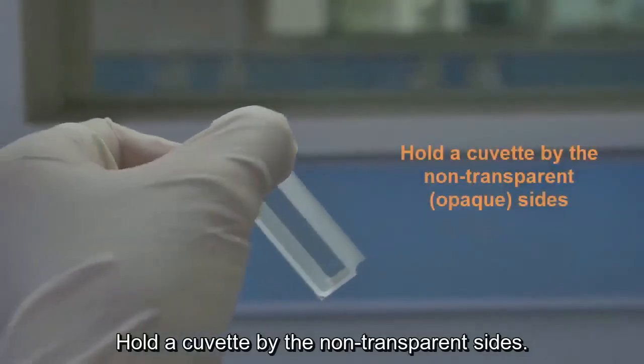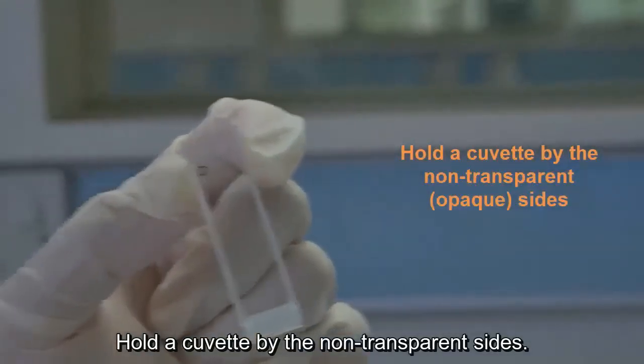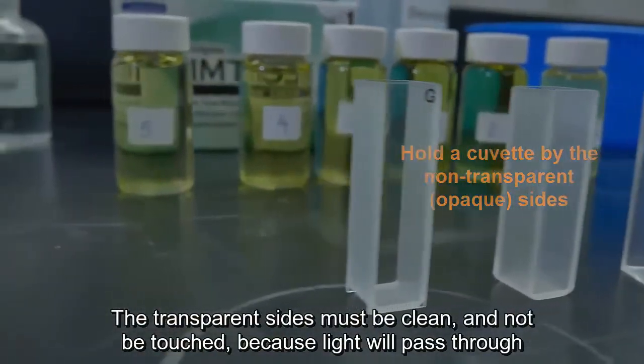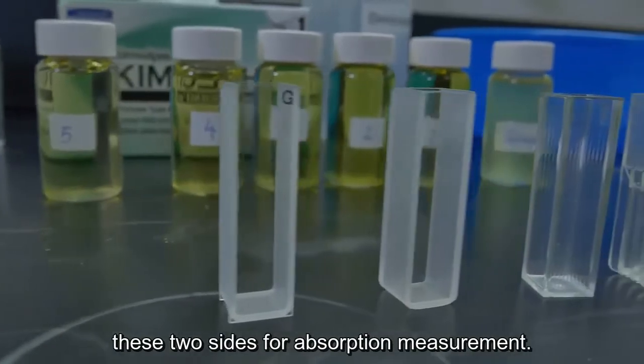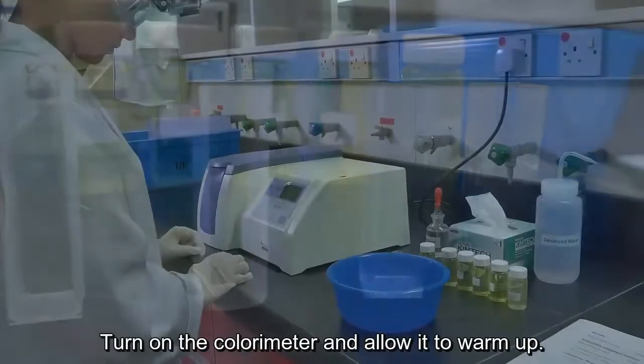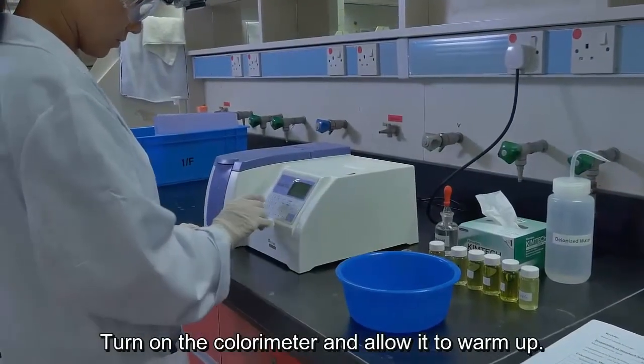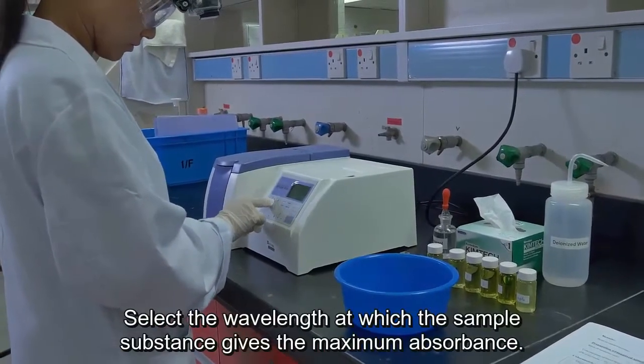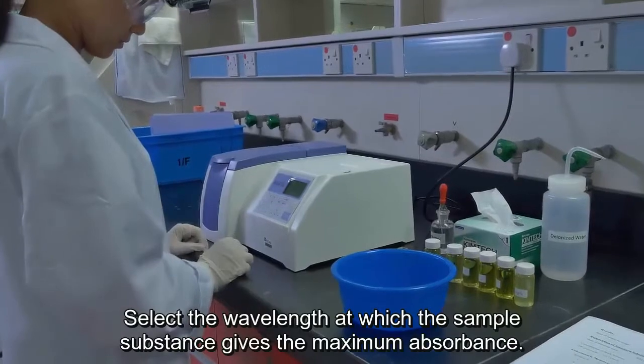Hold a cuvette by the non-transparent side. The transparent side must be clean and not be touched, because light will pass through these two sides for absorption measurement. Turn on the colorimeter and allow it to warm up. Select the wavelength at which the sample substance gives the maximum absorbance.